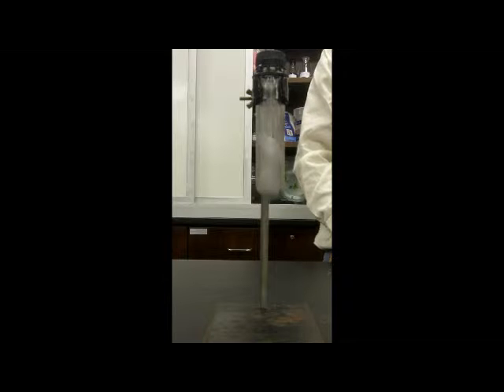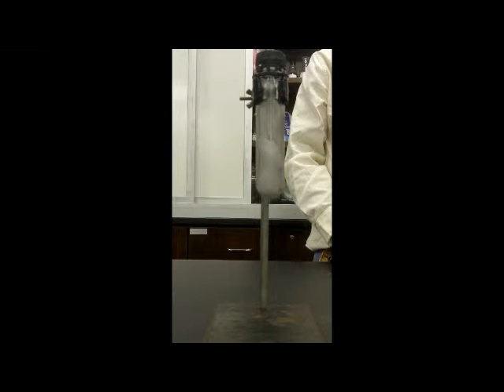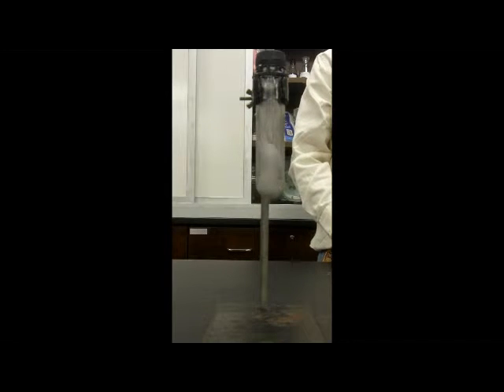Okay, there it goes. At the risk of boring you, I'm going to let it go. I can mention another comment or two. If you were to take this container in its thin wall variety, the thin wall variety is when it's actually made into a big 2-liter container, it'll blow up, and it'll cause a lot of harm. And look on YouTube, you'll see people doing that.